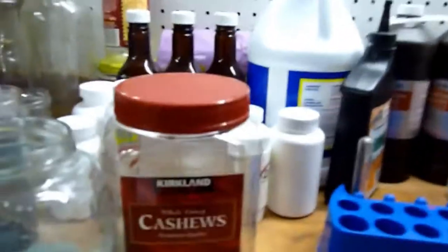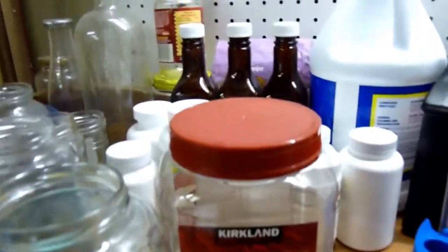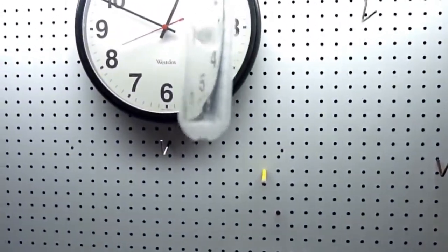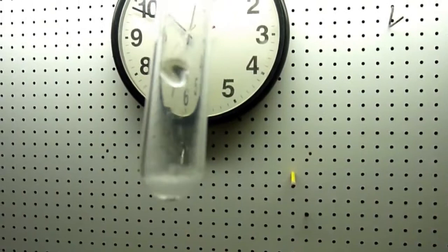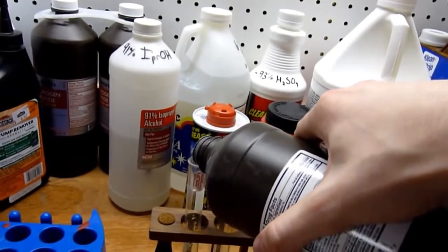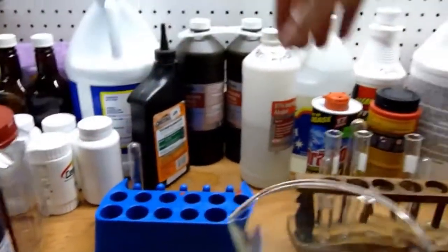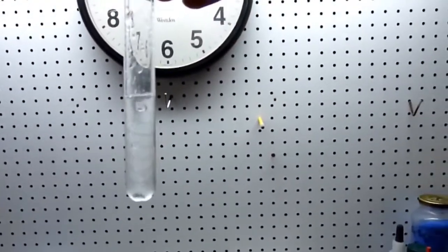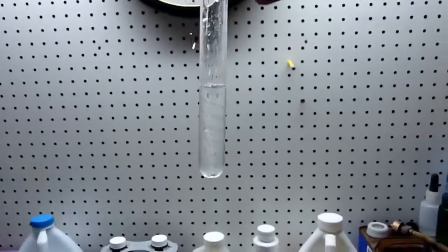First we get some 3%. Okay. So I'll put some 3% in here. And as you can see, my camera will focus on it. Maybe I'll add some more. There we go. You can clearly see the oxygen gas bubbling out of it. At a pretty fair rate. Okay.